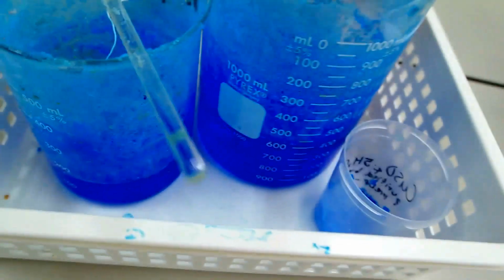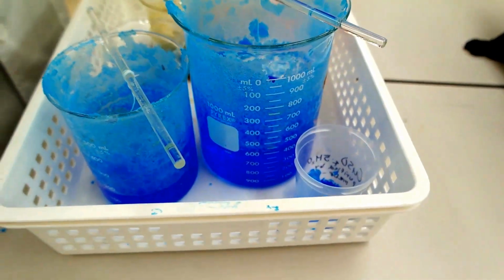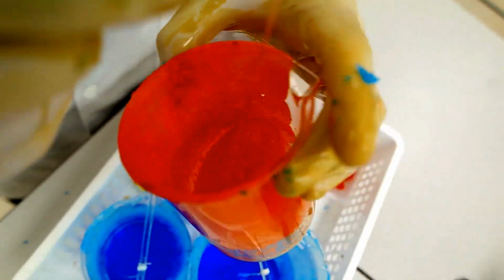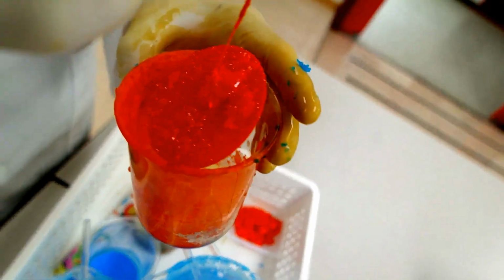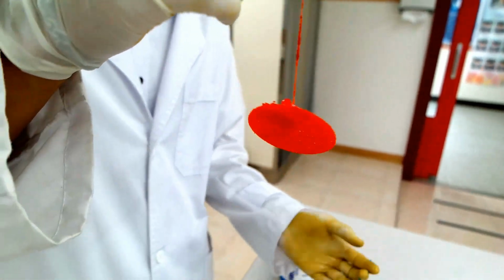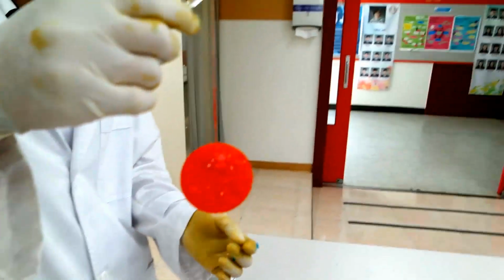So cool. And then what was this? I forgot. The thing about this was that I was too lazy to make another solution, and also this one's quite expensive, so I didn't. So it got stuck to the bottom. So it's pretty. Yeah, circular in some way.